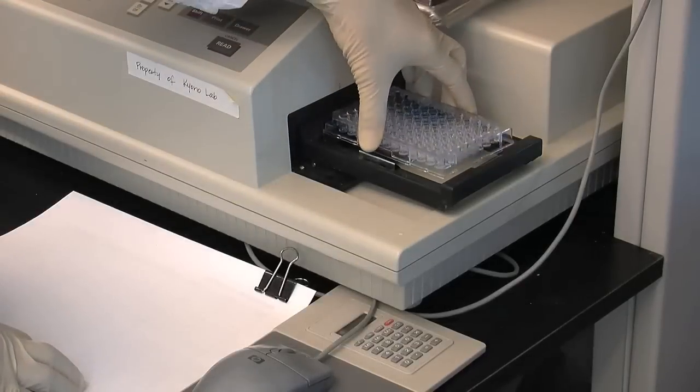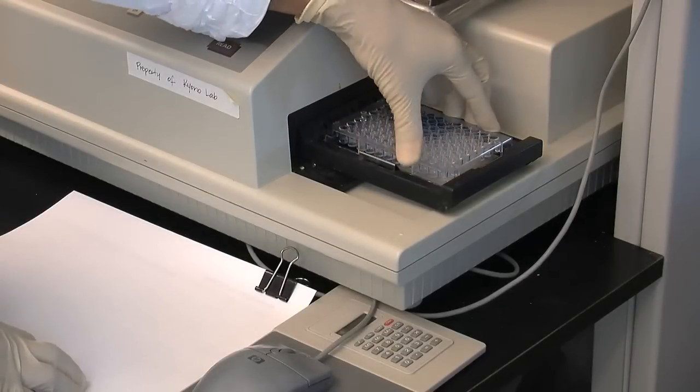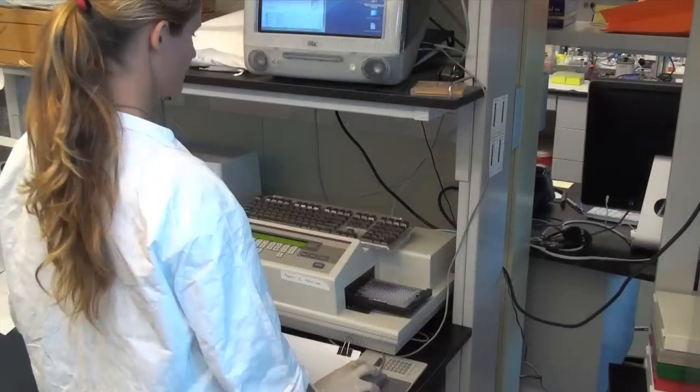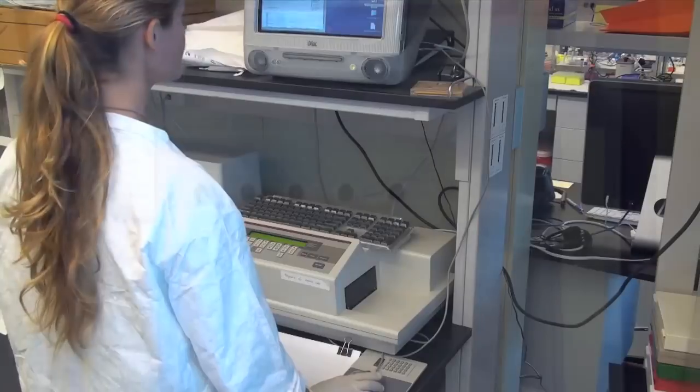Finally, the plate is inserted into a spectrophotometer SpectraMax 340 molecular devices, which reads the absorbance of each standard and sample at 595 nanometers. From the absorbance values of the known standard protein concentrations, the concentration of the unknown protein solutions can be calculated.